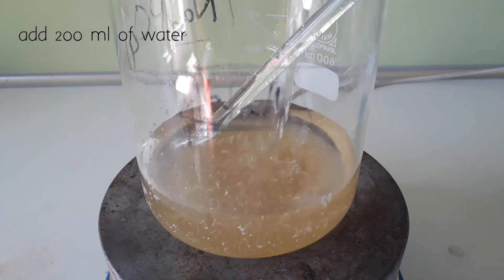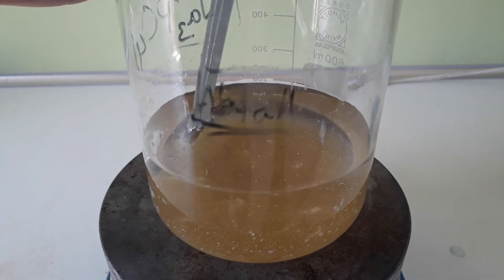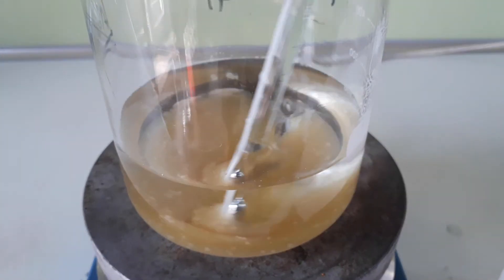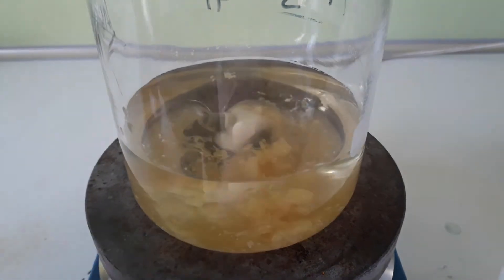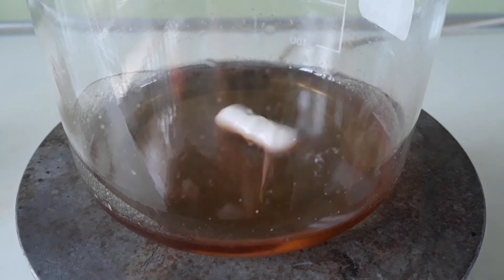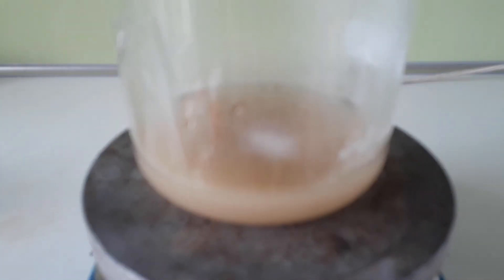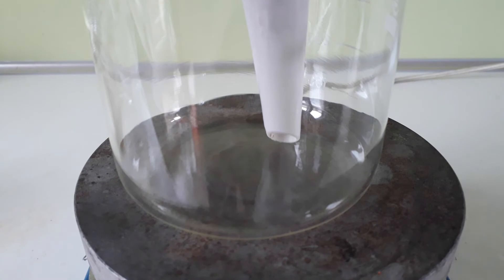To isolate the product from this caramel-like rock, I add 200 milliliters of water and heat it until everything dissolves. After reducing the volume of the solution, I let it cool down. And all of a sudden, a lot of salt crashes out. I wasn't really sure about the purity of that though, so I re-dissolved it by heating the mix again, filtered, and let it crystallize out slowly.